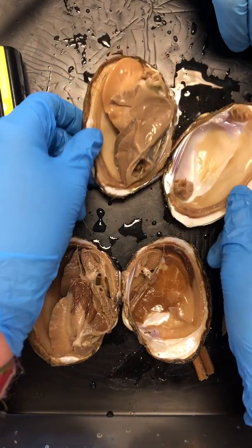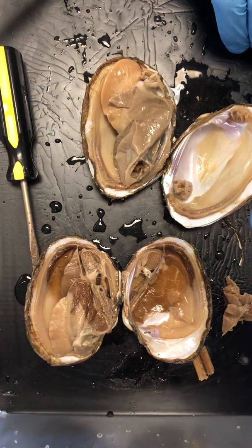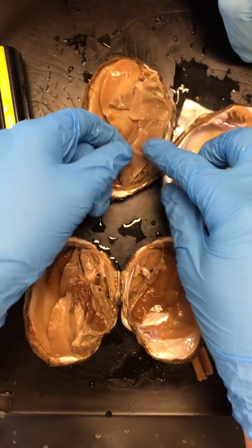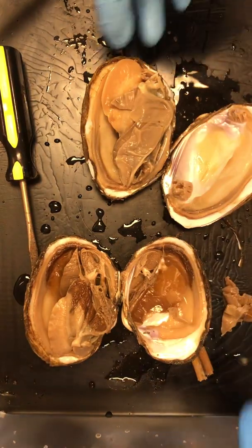Next piece we care about is our visceral mass, which is basically everything else. So let's look at it in a little bit of detail. If we're starting up top here, these floppy layer pieces are on top of your foot as well as underneath your foot, right down here. Let me get my pointer thing.